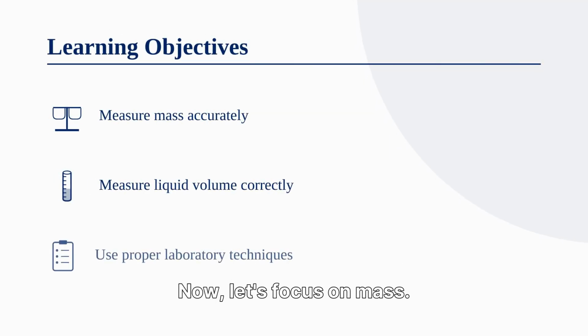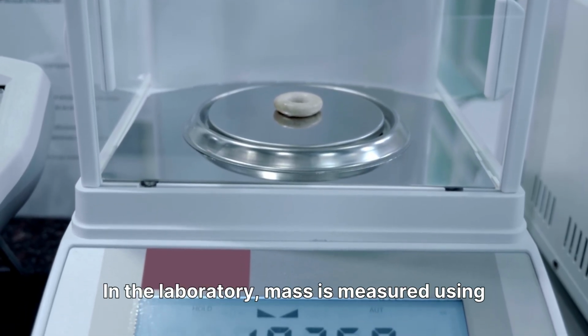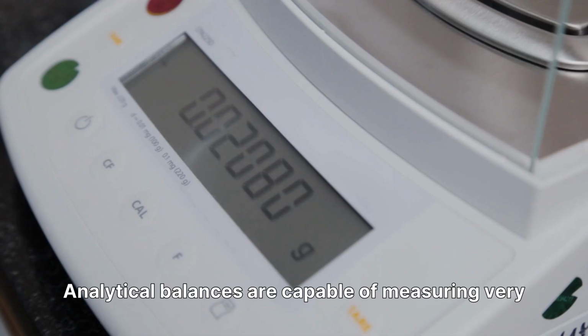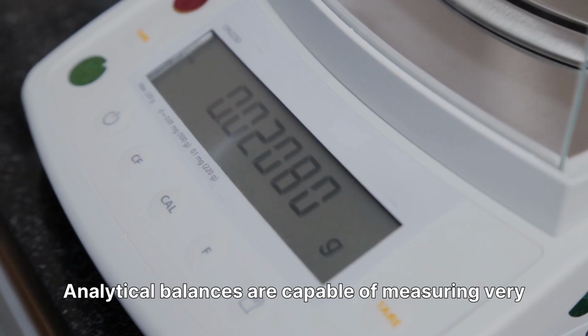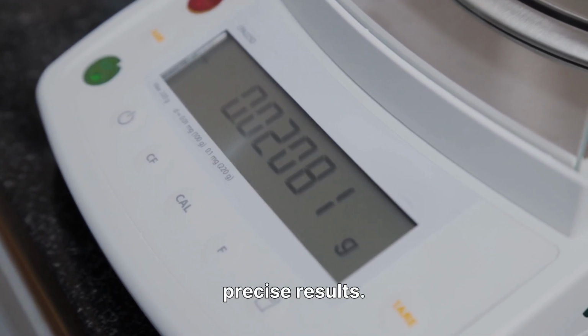Now let's focus on mass. Mass is the amount of matter present in a sample. In the laboratory, mass is measured using an analytical balance. Analytical balances are capable of measuring very small differences in mass and provide highly precise results.